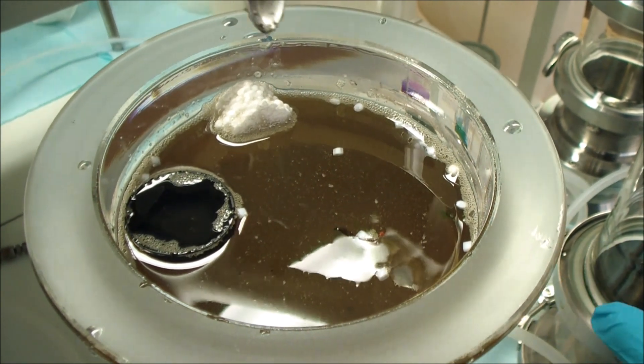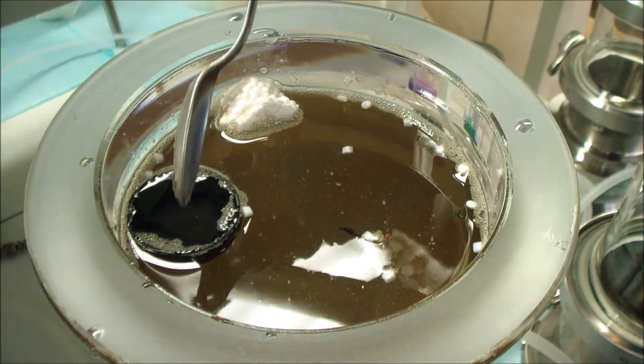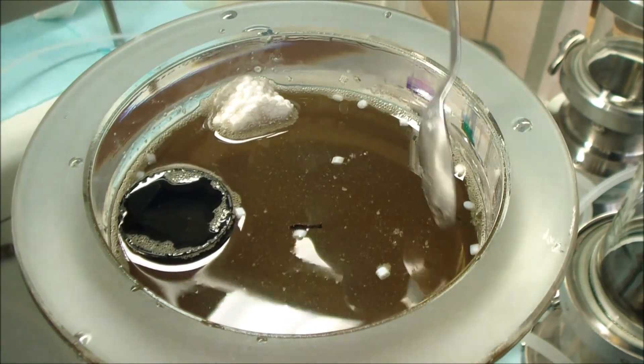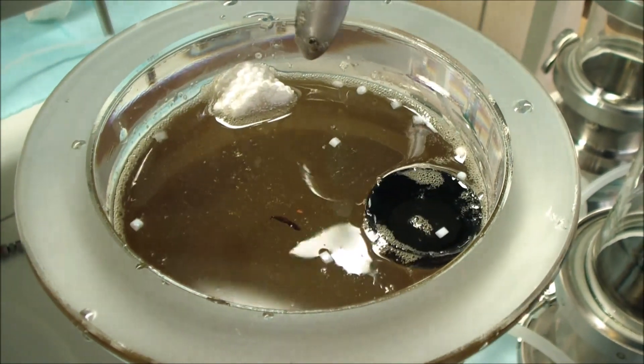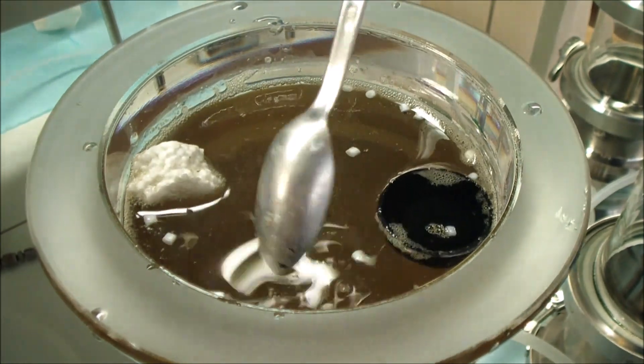So, here's all the plastic that we actually put in the sediment and got back out. These PET pieces that you see are now floating, not sinking. Here is a bottle cap, and there's also some polystyrene we put in that sediment.